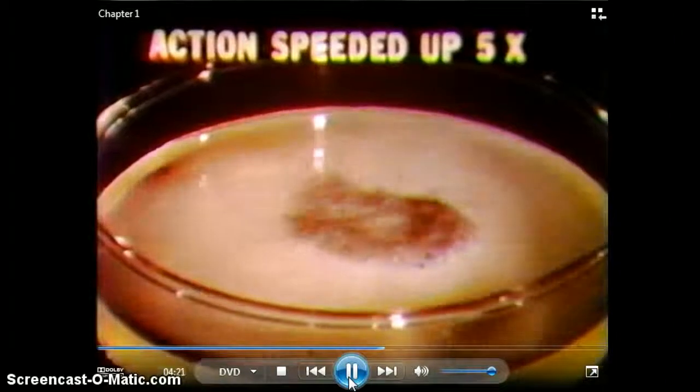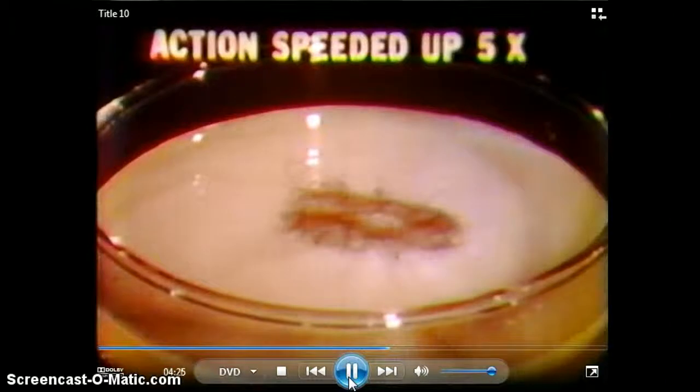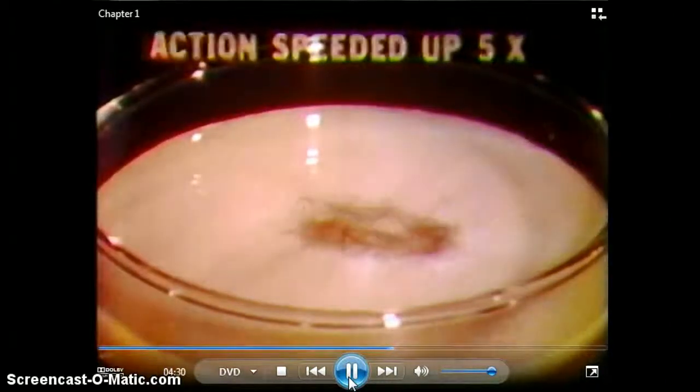This petri dish contains a dilute solution of hydrochloric acid. Watch how it reacts with iron — in this case, a piece of steel wool. While hydrochloric acid may not burn the skin readily, it does react rapidly with the more active metals to form hydrogen and the metal ion chloride, in this case iron chloride. Notice the gas being evolved: hydrogen.